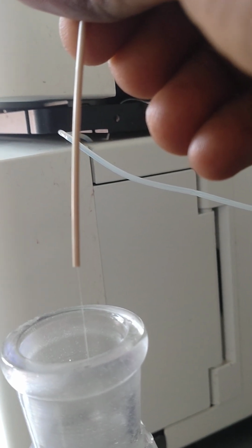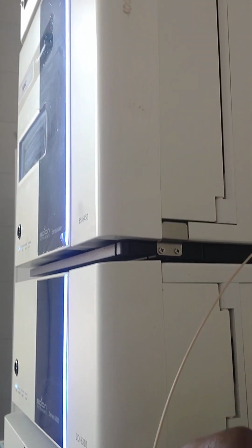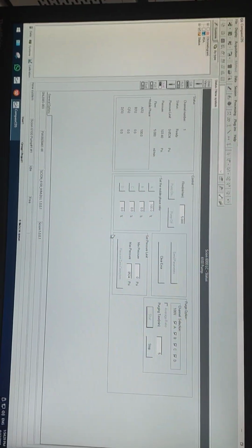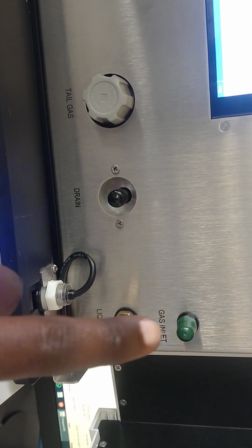So you can see the flow is ready, is steady. So therefore the pump is working properly. But the only problem that we are having is only the detectors. Since two detectors are not connected, for example, this evaporative light scattering detector, you see that it is not connected from this drain and this liquid inlet, as well as the gas inlet.